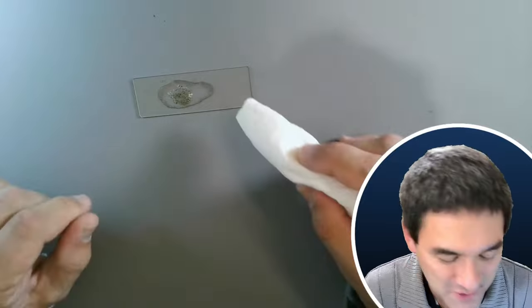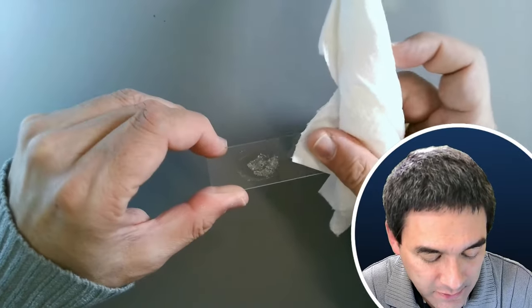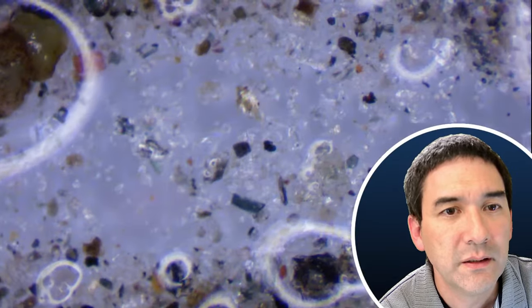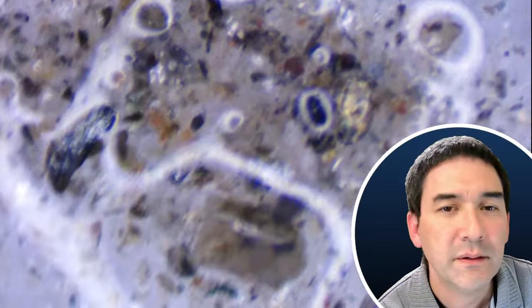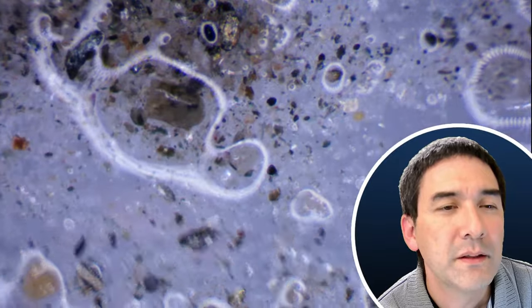Pyrite is also known as poor man's gold. In German you call it Katzengold — I don't know why they call it that. It's of course not gold. I'm going to put this now under the microscope. It always takes a little bit of time for the whole thing to respond. Here we go. You can already see some shiny sand grains — like this one over here — some that look a little bit like gold.